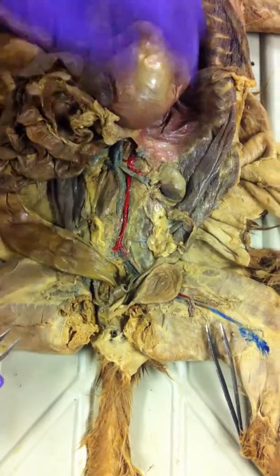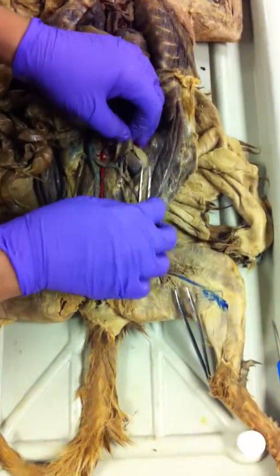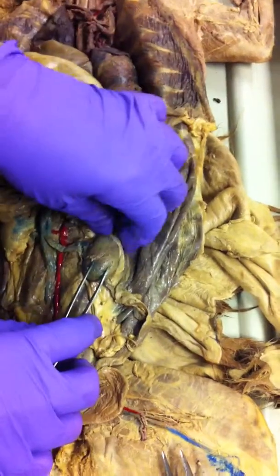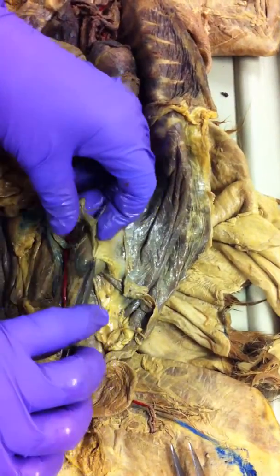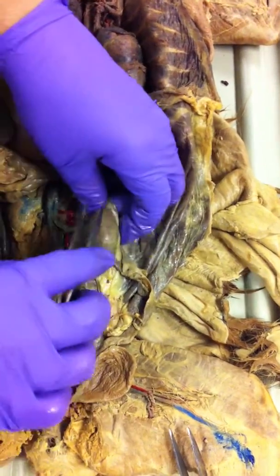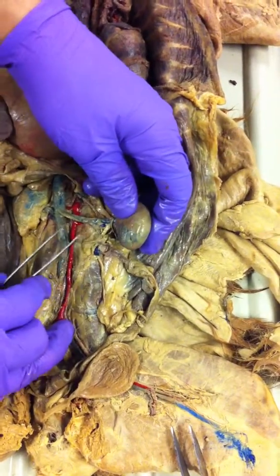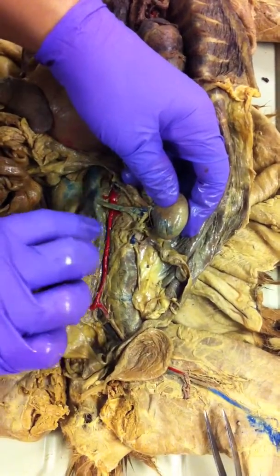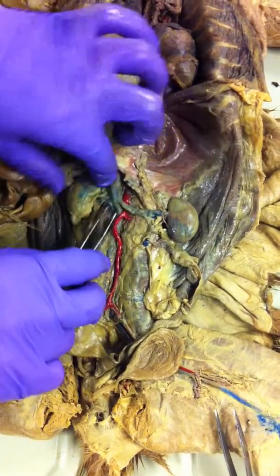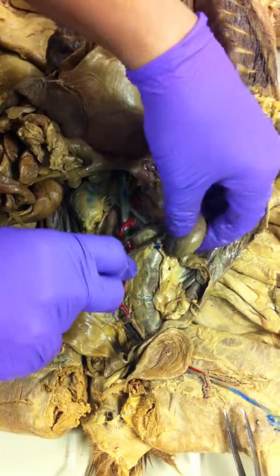That's your digestive system. Urinary system includes just three major structures. That's the fascia covering the kidneys. This is your kidney. This is the left. This is the right. This is your inferior vena cava. This is your abdominal aorta. And here the branch is cut, but on the other side I think it's more obvious. No? Okay.